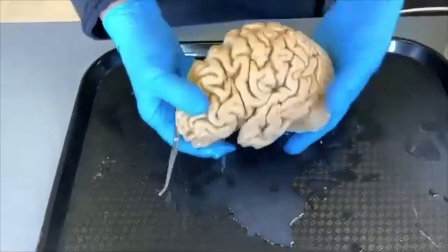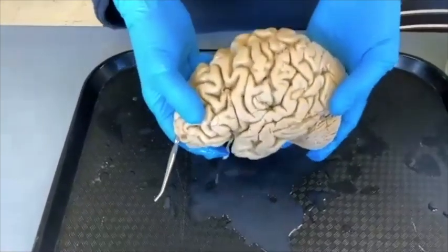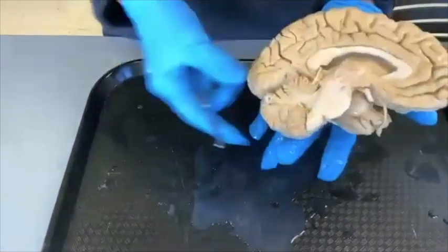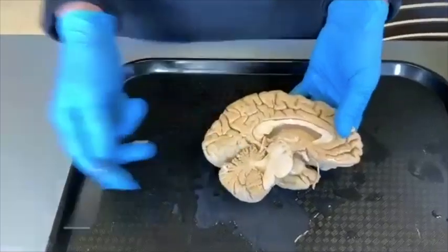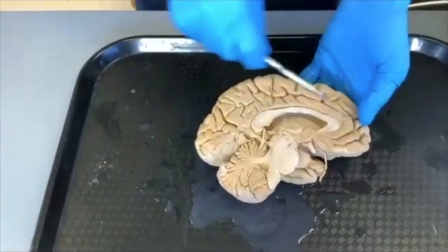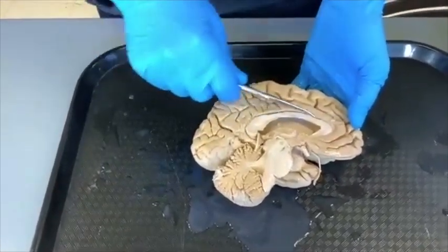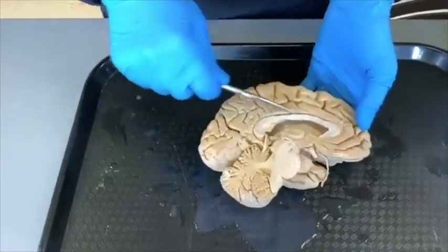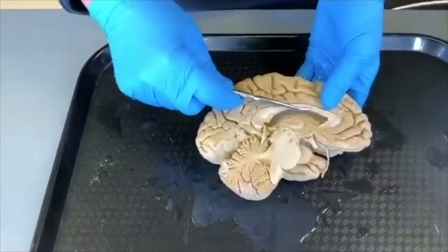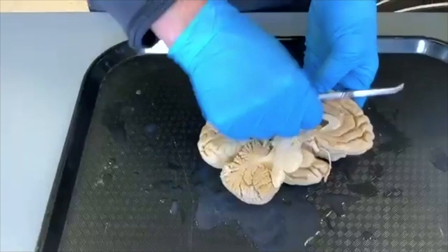This is hindbrain and this is telencephalon. From the side in the human brain you cannot see anything else — no medulla, no pons, no midbrain, no diencephalon. That's the beauty of a midsagittal section. Here's the telencephalon and here's our comb-over. This is the corpus callosum — a big fiber tract with axons going from one hemisphere to the other.